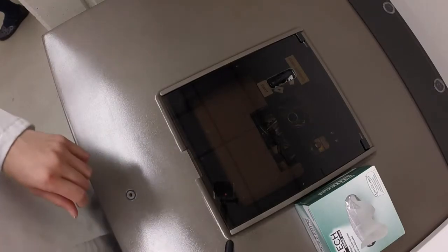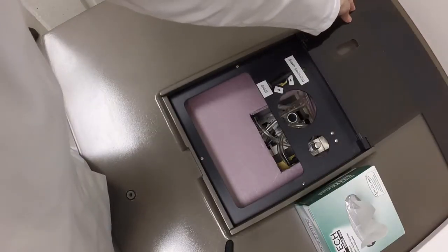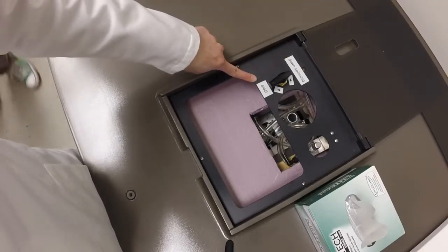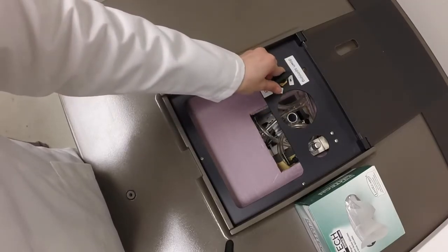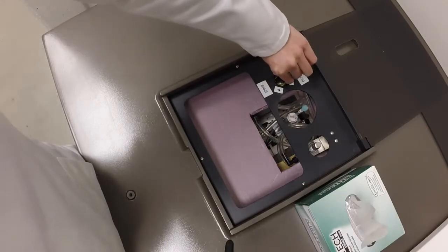So this is the top view of the NMR, and we can just lift open the top. The valve should be on down spinning when there is a sample inside, and turn to eject to remove a sample. In this cylinder is where samples will go, and there's always a sample in the NMR. We're going to turn the valve clockwise to eject the current sample.